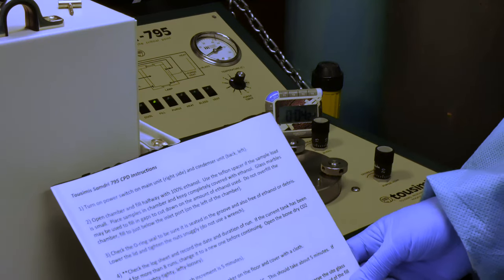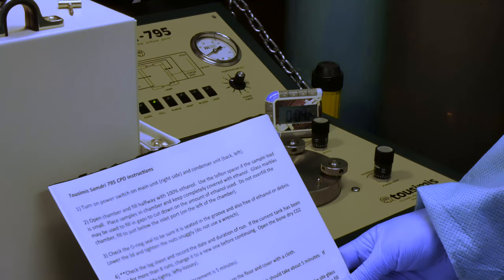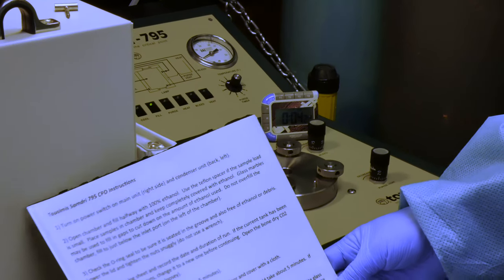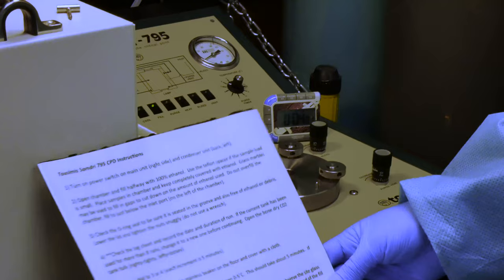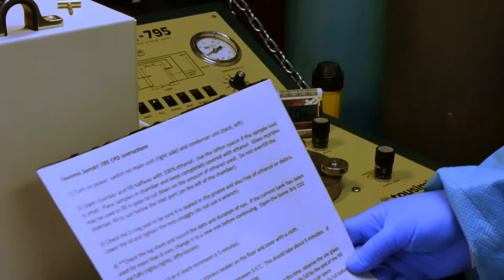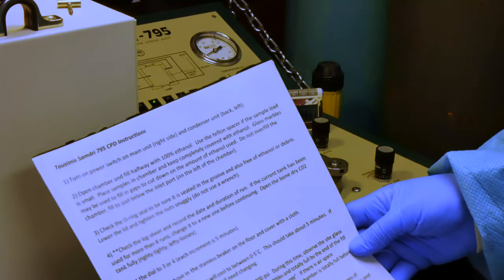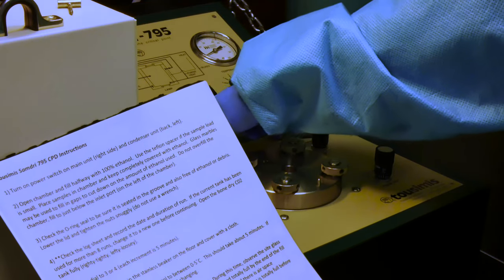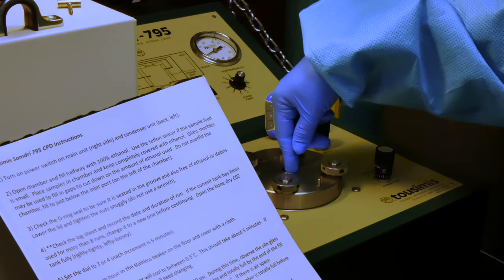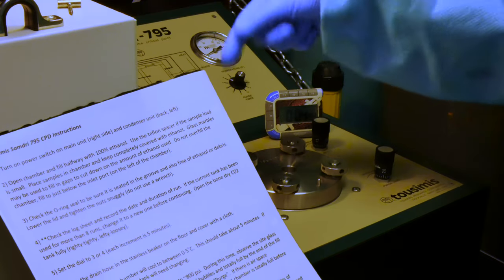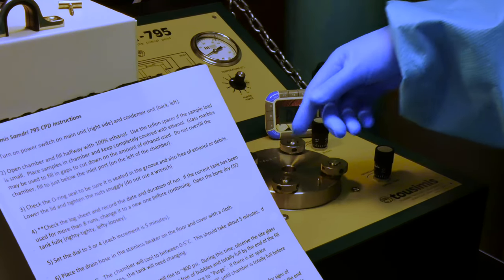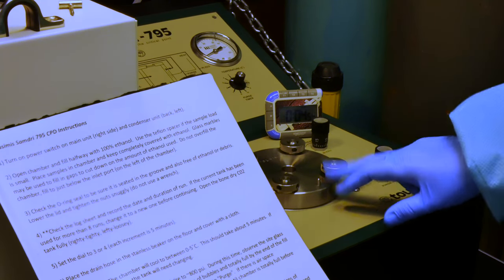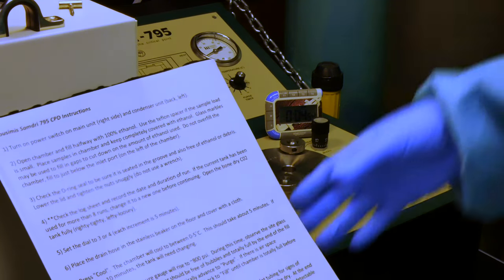The unit will automatically advance to purge. If there is air space at the end of that, we can always revert back to fill to ensure that the chamber's full. If once it advances to purge and you still feel like there's air space in the chamber, you can revert back to fill to see if it'll add any more. If there's air space in the chamber, you may at that point also need to exchange tanks.